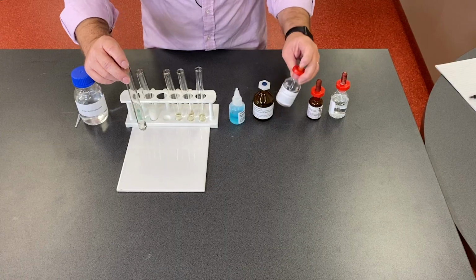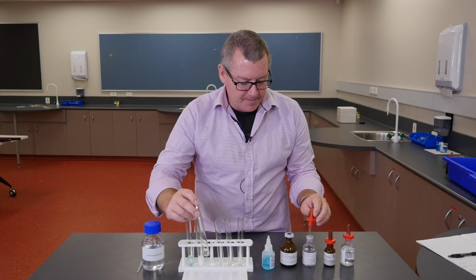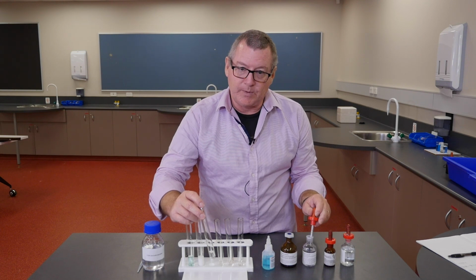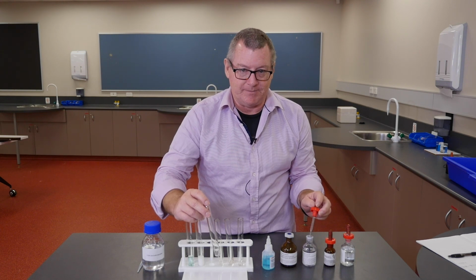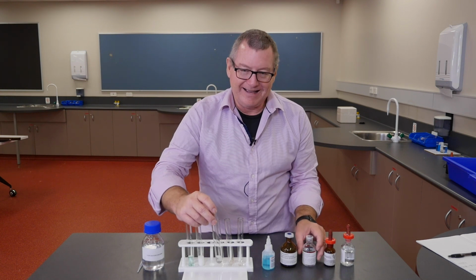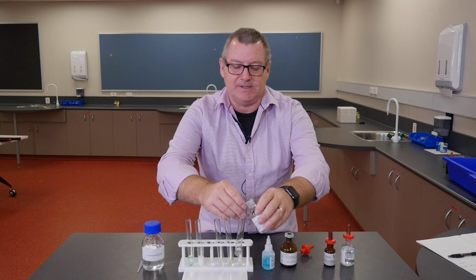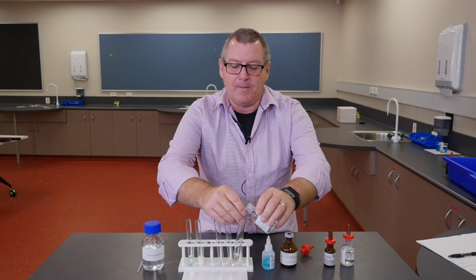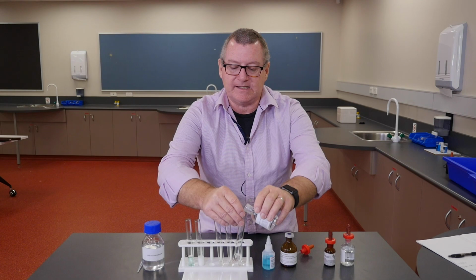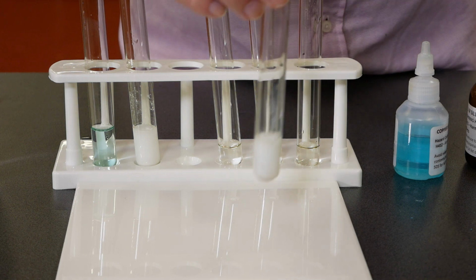Calcium chloride again, and ammonium oxalate. In this case, the ammonium, NH4+, is a positive ion that's compound, not just a metal. And oxalate, I have to admit I can't remember the full formula. It's an organic substance as the ion. And we'll see whether, again, calcium oxalate or ammonium chloride is a precipitate, and indeed it is.